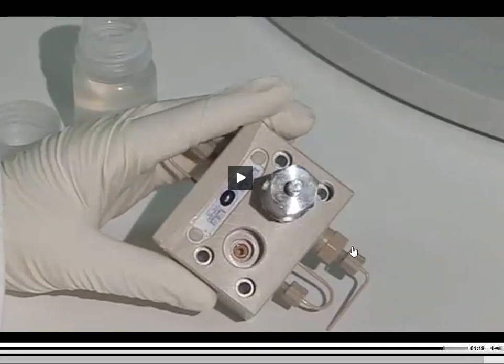All right. So that's as easy as it is to change out a pump seal on the inside of that instrument. You would need to do it to the left-hand one, and you probably need to do it to the right-hand one too at the same time. Keep it consistent. If you're going to replace one, this sucker's already off, so you might as well do it to both sides while you have it off. I mean, no big issue there at all, right?